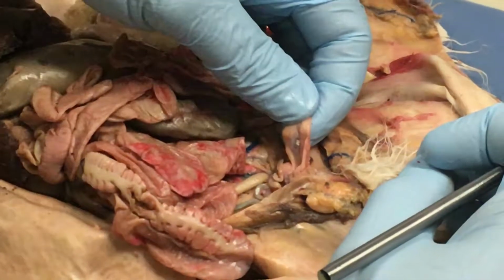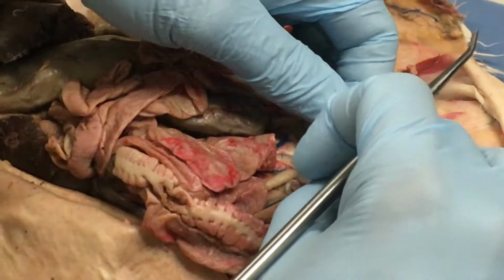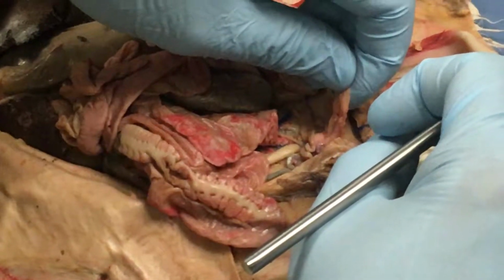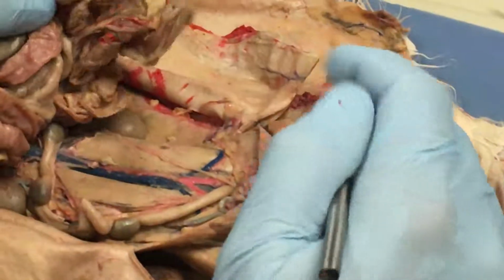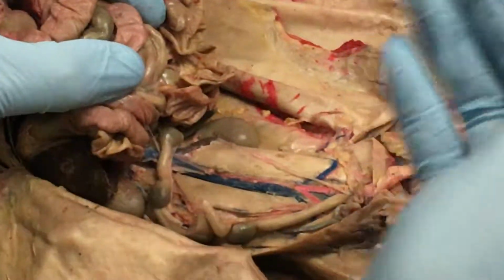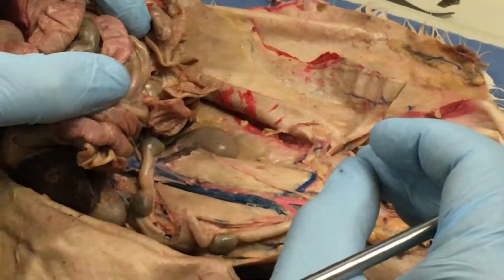But this is typical of a membrane that does have a different function. It holds the urinary bladder to the ventral body wall. But you don't need to know that for this test. For this test, you just need to know that it does what? Produces fluids to reduce friction. All right, the dorsal mesentery was all covering all of this. Which of course would betray a much different function than producing fluids to reduce friction, but it also produces fluids to reduce friction as well.